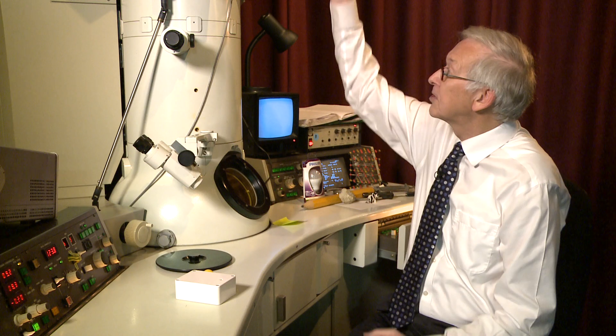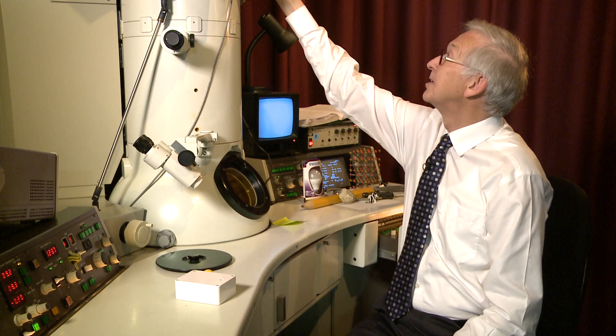In this electron microscope, we start by switching on the high tension — the accelerating voltage. This microscope uses electrons with an energy of 400,000 electron volts, so we have a voltage generator producing 400,000 volts, stable to within one volt over minutes. The electrons are then accelerated through a potential difference of 400,000 electron volts down this column, and the specimen is inserted on a long specimen rod that sits it right in the center of the microscope column. The electrons hitting the specimen have almost the speed of light.